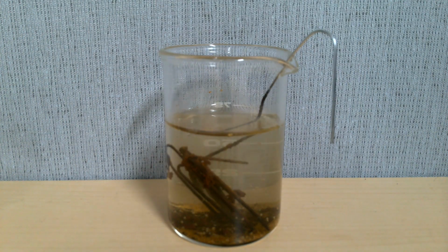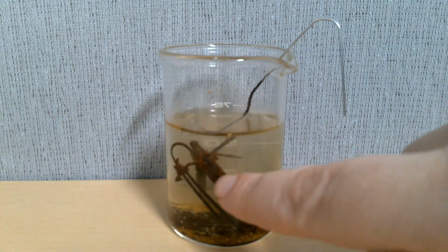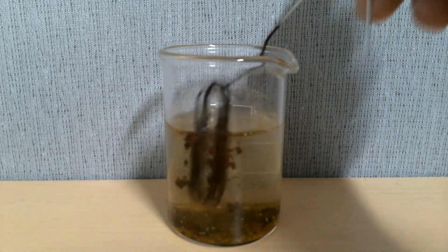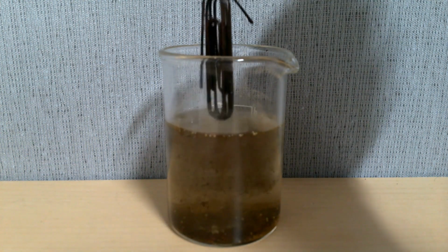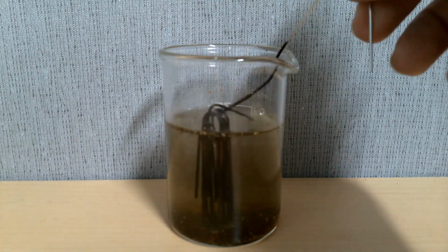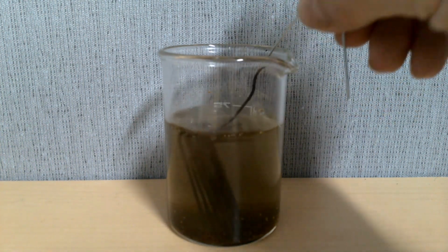So as you see here, the copper that was in the solution was represented by the blue solution. As those copper particles came out of the solution, that is copper there. And you could say the copper grew, although that's not a proper term. But the copper was in the solution and it came out. And then the metal that this was made out of, which was iron, the iron came from the paper clips and went into the solution. So the copper and iron switch places.